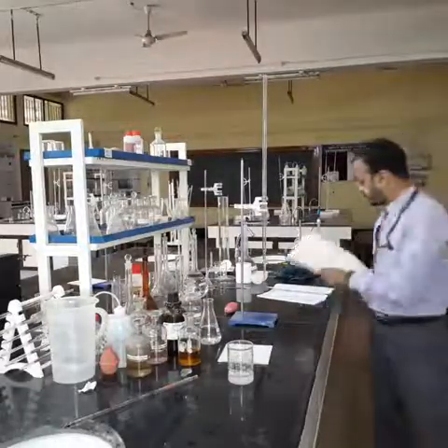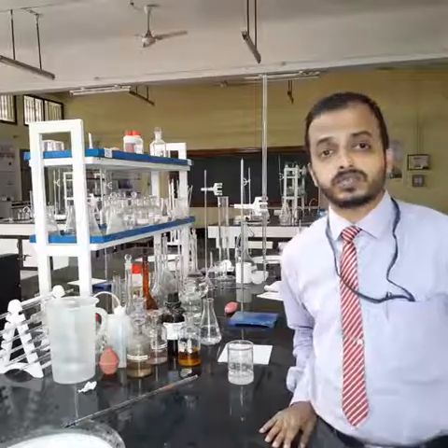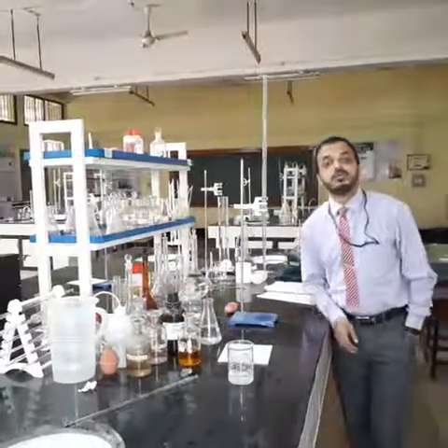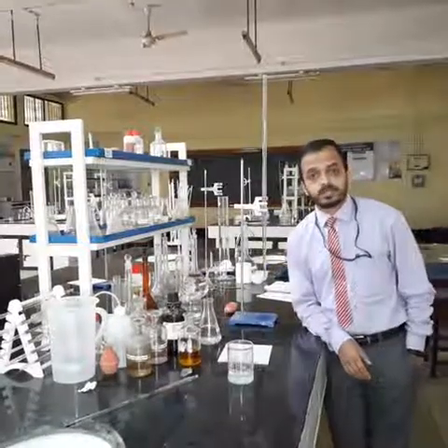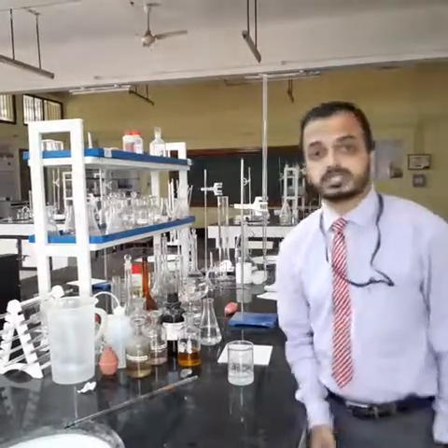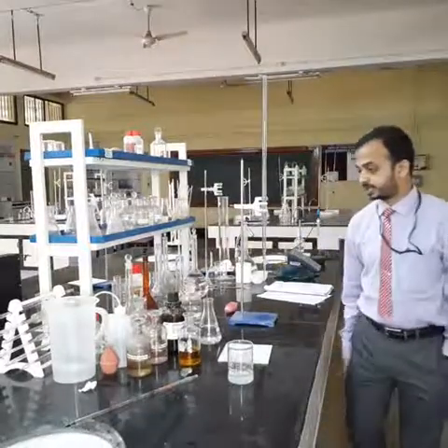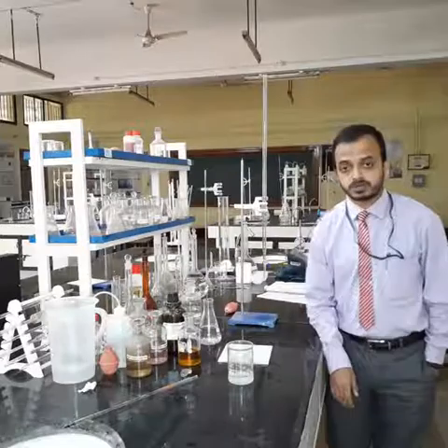From the value of the DO of the given sample, you have to conclude whether the DO is within the permissible range or not, or whether the given sample has the minimum value of DO, that is 4 mg per liter, or not. This is a brief description of the procedure that you need to carry out to determine the dissolved oxygen in the given sample. The same procedure is to be repeated for the sewage sample also.